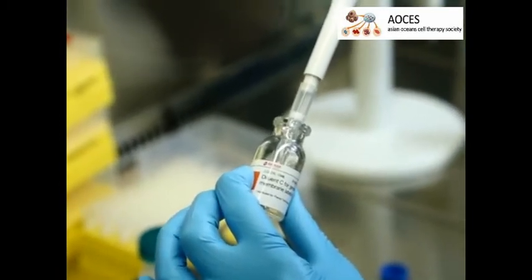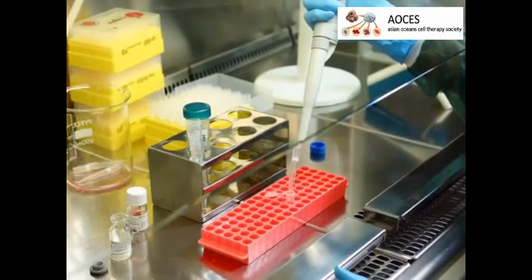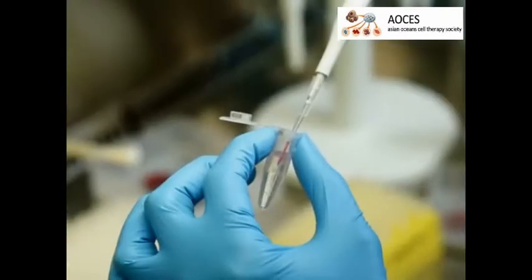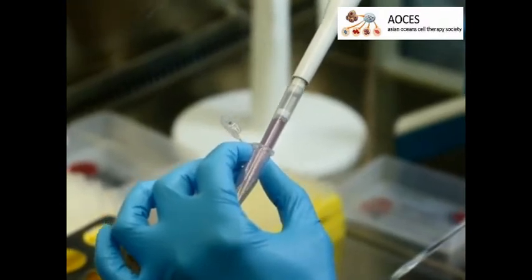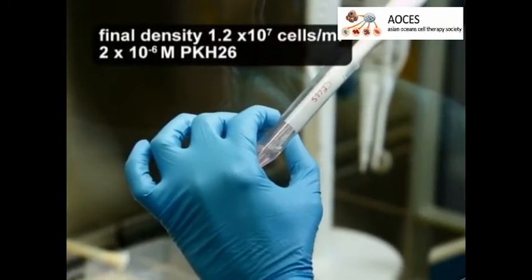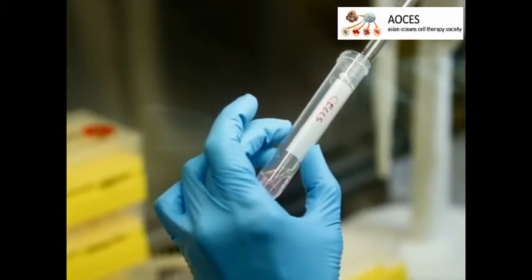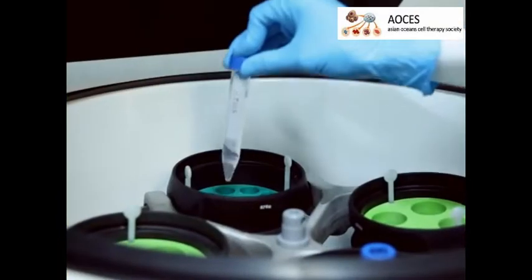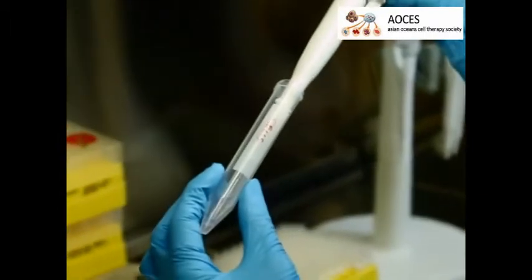Immediately before staining, prepare a 2X dye solution in diluent C by adding 4 microliters of the PKH26 ethanol dye solution to 1 milliliter of diluent C in a tube and mix well to disperse. Quickly add the 1 milliliter of 2X cell suspension to 1 milliliter of 2X dye solution and immediately mix the sample by pipetting. After incubating the cell-dye suspension for 1 to 5 minutes, stop the staining by adding an equal volume of 1% BSA solution in HBSS and incubate for 1 minute. Then centrifuge the cells at 500×g for 10 minutes and carefully remove the supernatant.